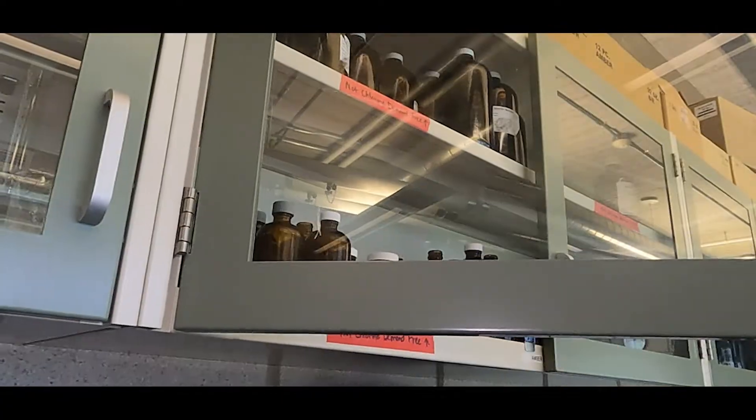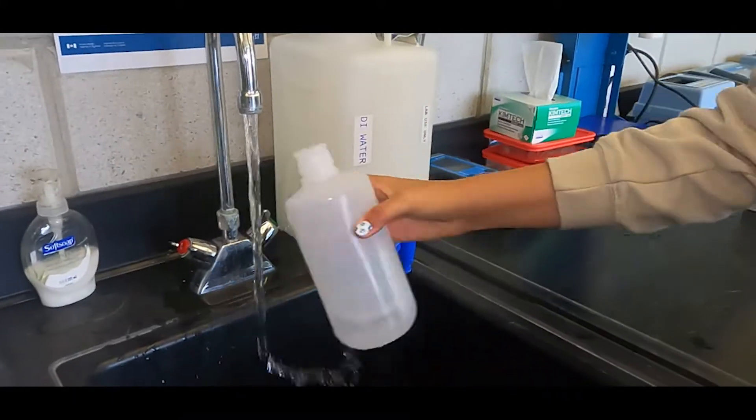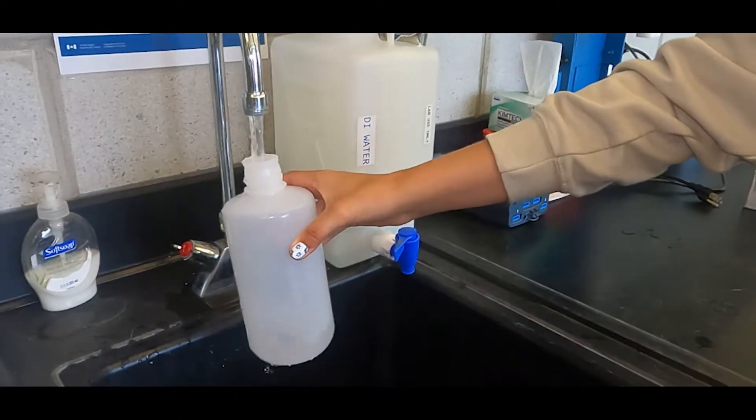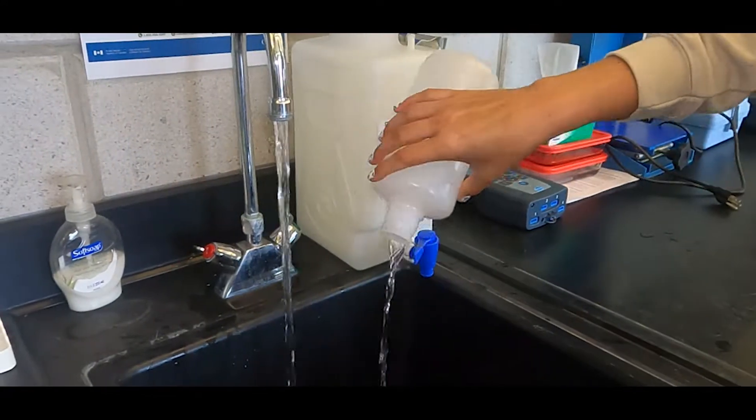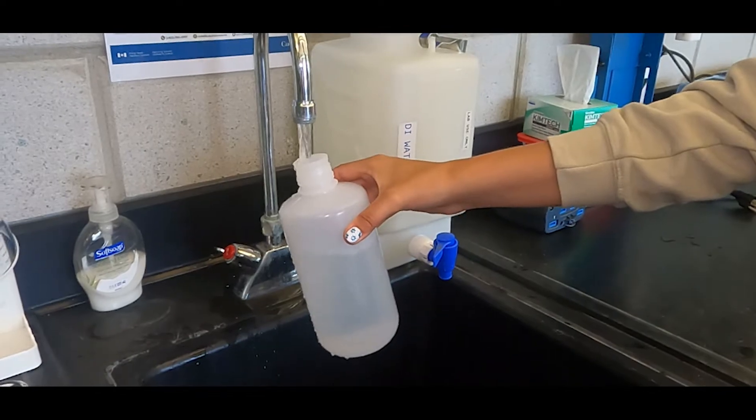Collect your sample in clean glass or plastic bottles. Analyze the sample as soon as possible for the best results. If the sample is refrigerated, let it come to room temperature before the analysis.